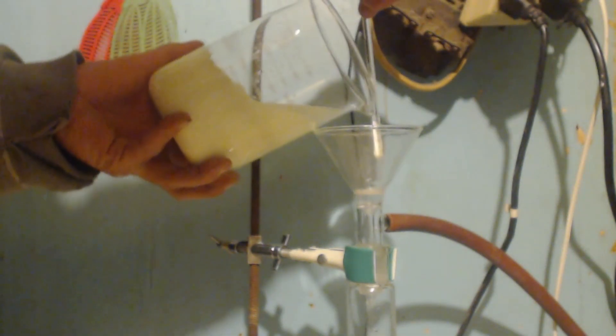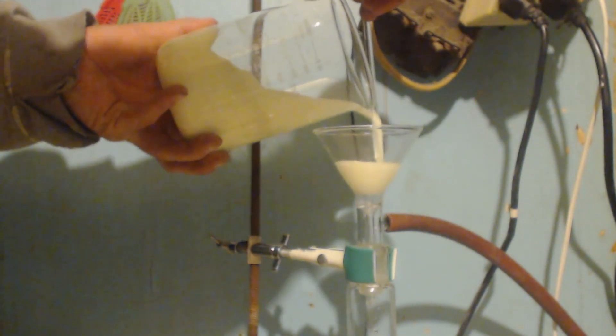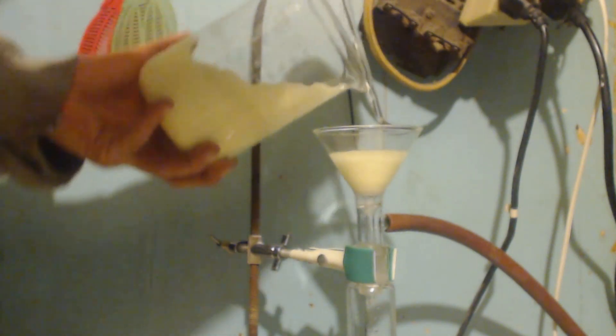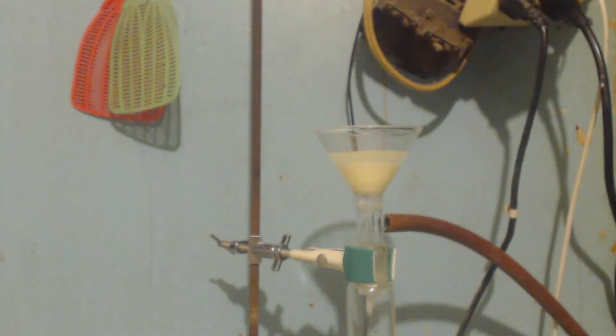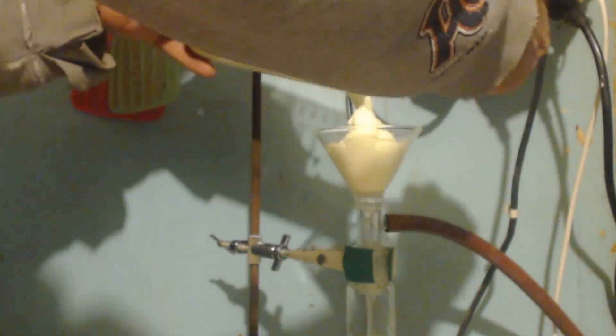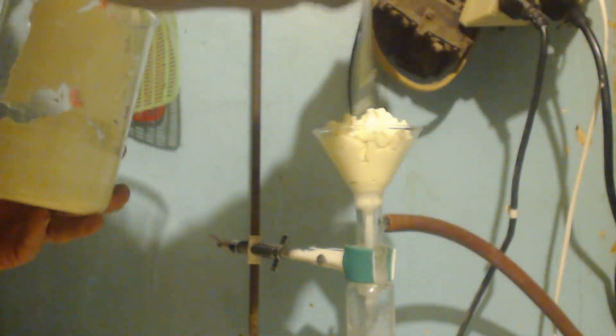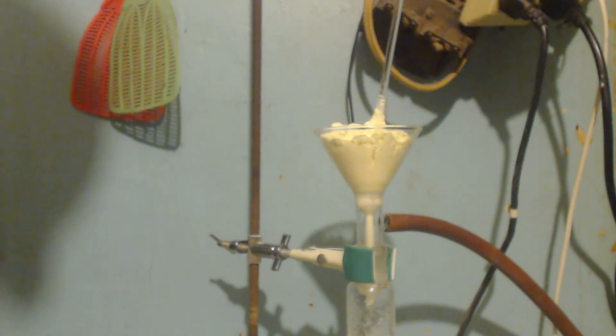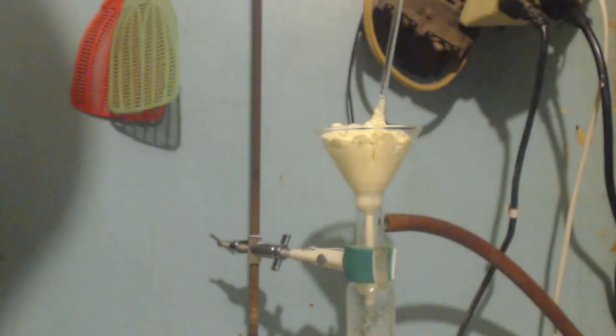I'm going to filter it. I'm going to have to do this in two shots because it's not fitting into the funnel. My big frit funnel is broke. This is all I got left here is these little ones. So, anyways, I'm going to leave that on there until it stops dripping and it's nice and dry.